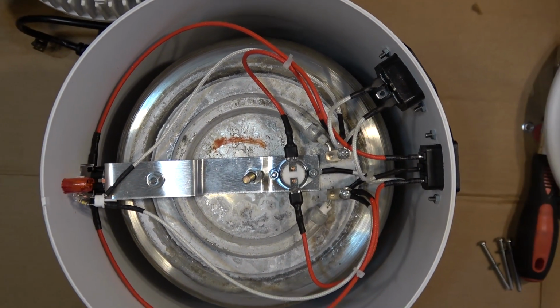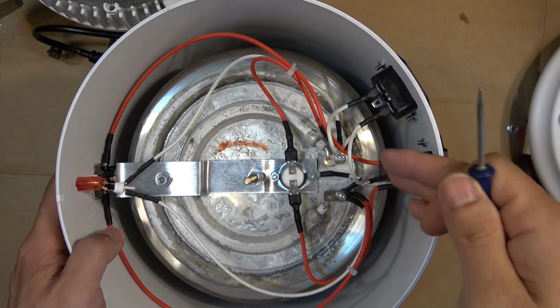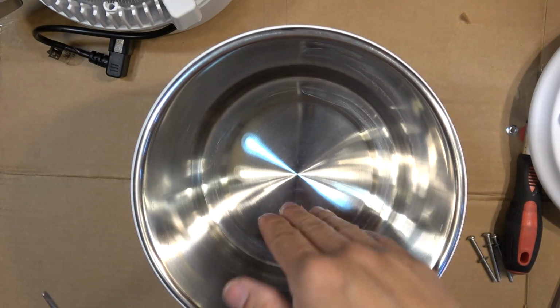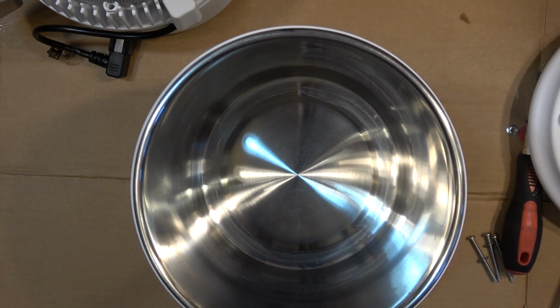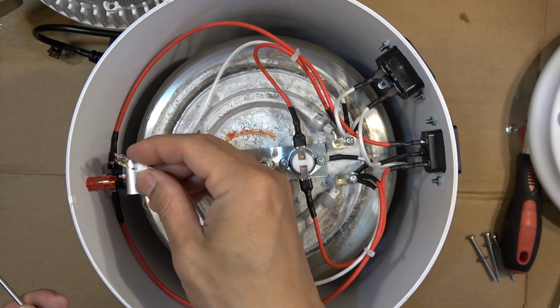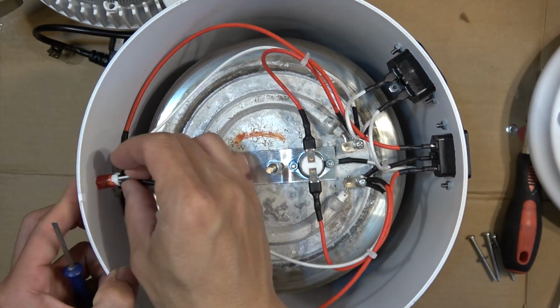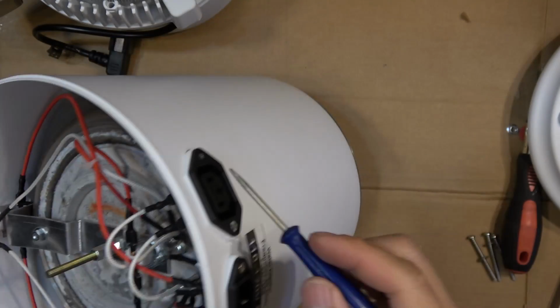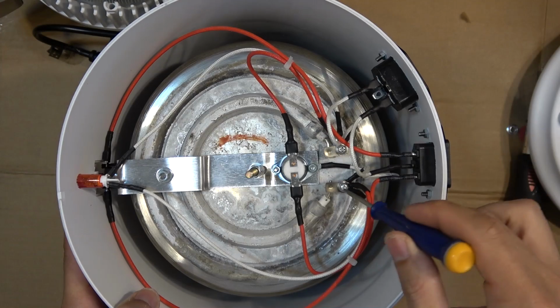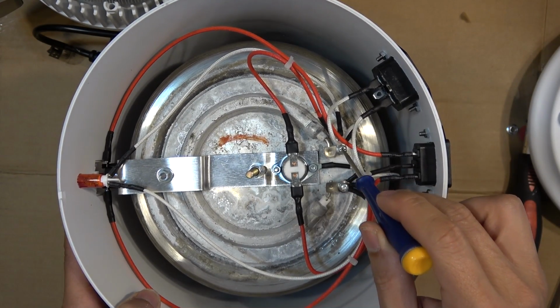This is important because if there's a short down here, if it's not grounded, up here if you just touch the water or the pot itself, you might get electrocuted. Over here we got a light bulb. It's not LED, just a light bulb mounted with a resistor in series. On this side we got the connector for the fan. So these two wires go one side to one end of the heating element, one side to the other end of the heating element.